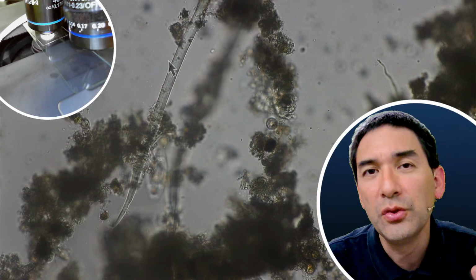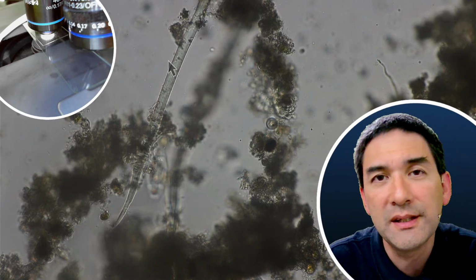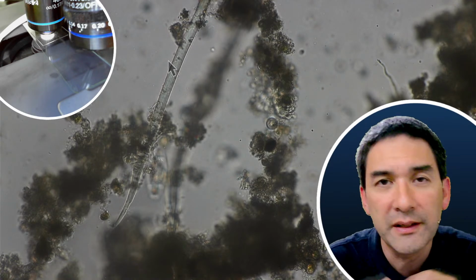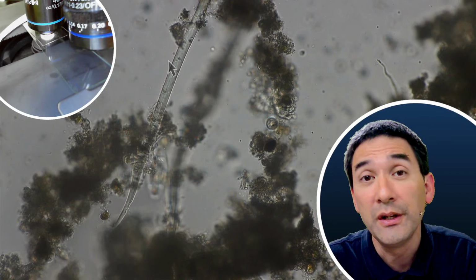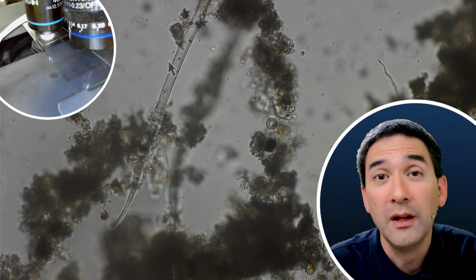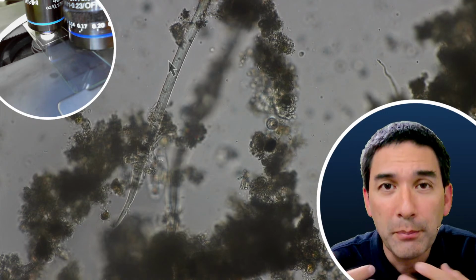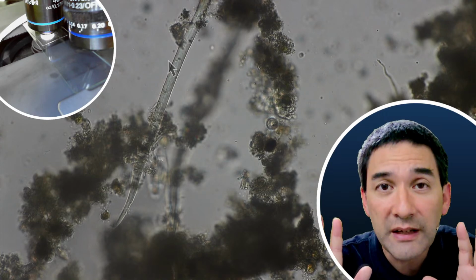So what would I use? Well, I would basically try different mounting media and see which one actually works best for my purposes. Considering that some of the specimens are not expensive anyway, you might just try it out. Usually when I look for dust, let's say pollen, or maybe I want to find insect parts or butterfly scales, simply for observation, I put it directly on the microscope slide. I do not even add a mounting medium.